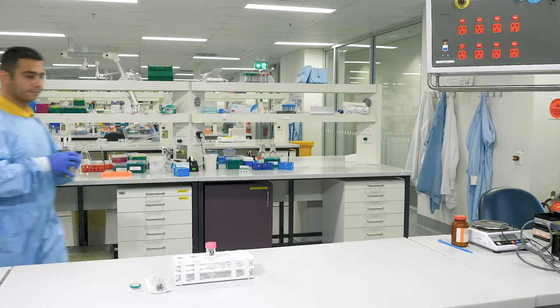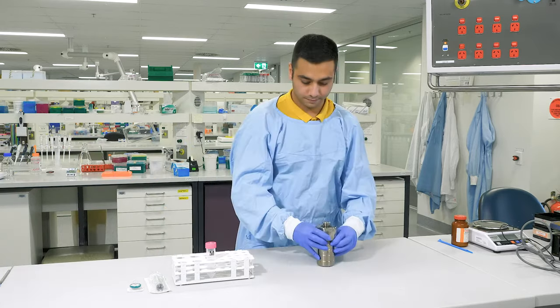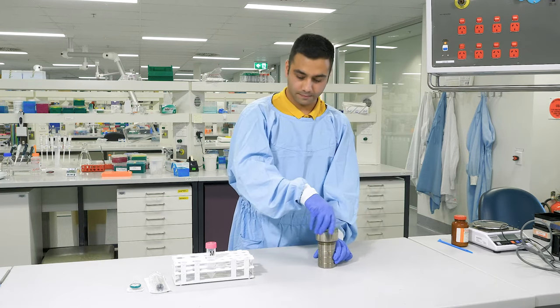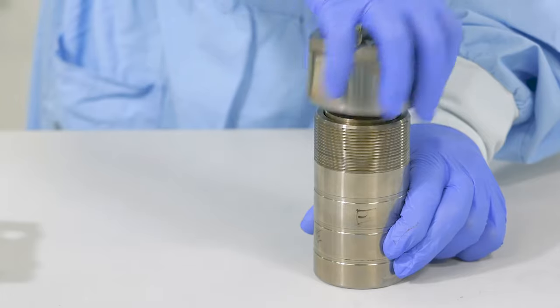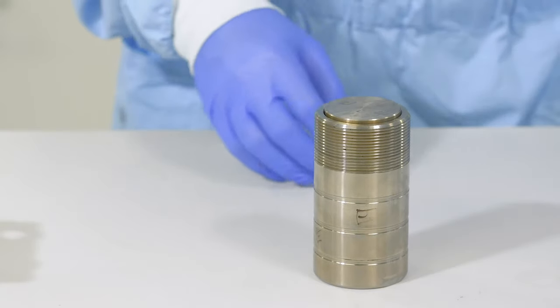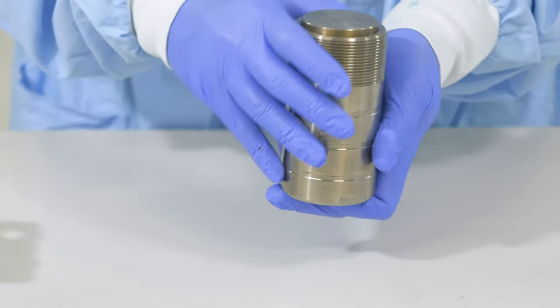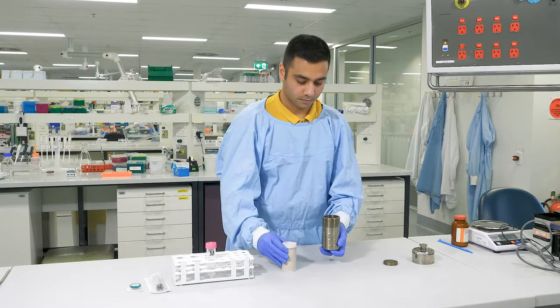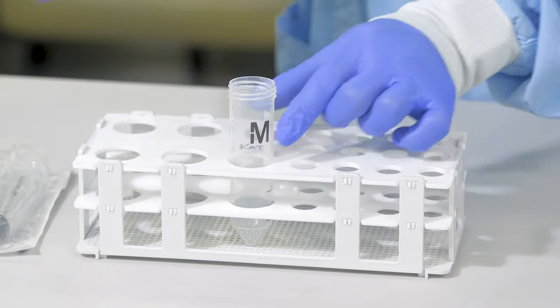Okay, now we are at the workbench again. The autoclave reactor is cool to touch. Now I will open it up. Now we need to purify the solution in the reactor. The purification should be done as there might be some unreacted or overreacted particles or even some contamination in the solution.